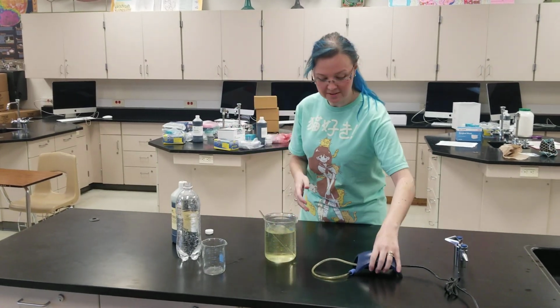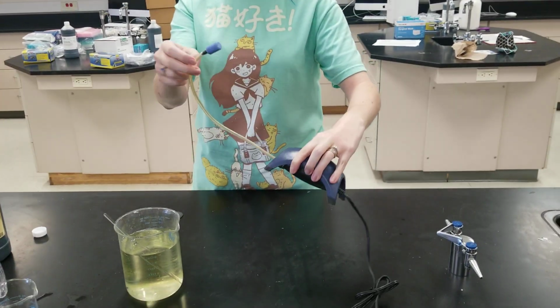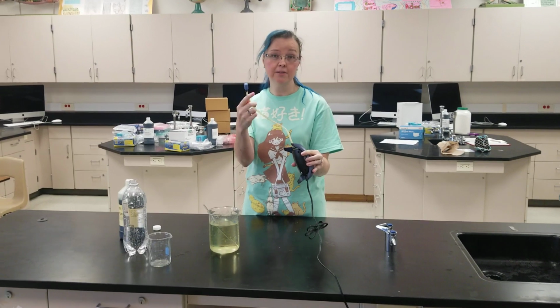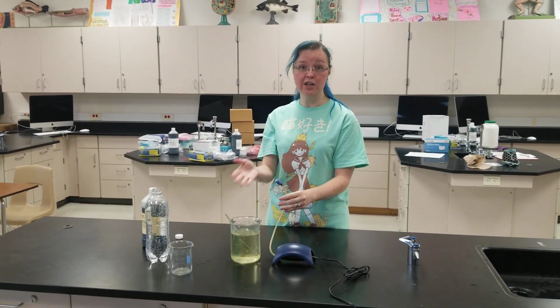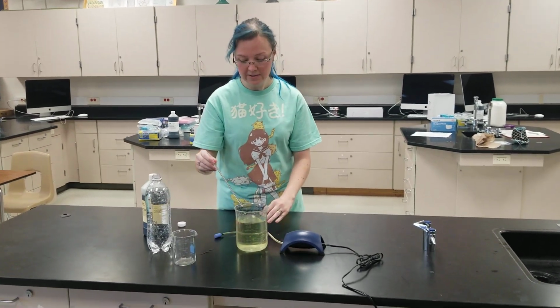We can use a little fish tank pump. So this fish tank pump has this little bubbler at the end here. It's going to make all these little bubbles. You put it in a fish tank so the fish have lots of oxygen. So I'm going to use this and see if we can change it back to the original color that we had there. Now I'm going to pause for a second here.